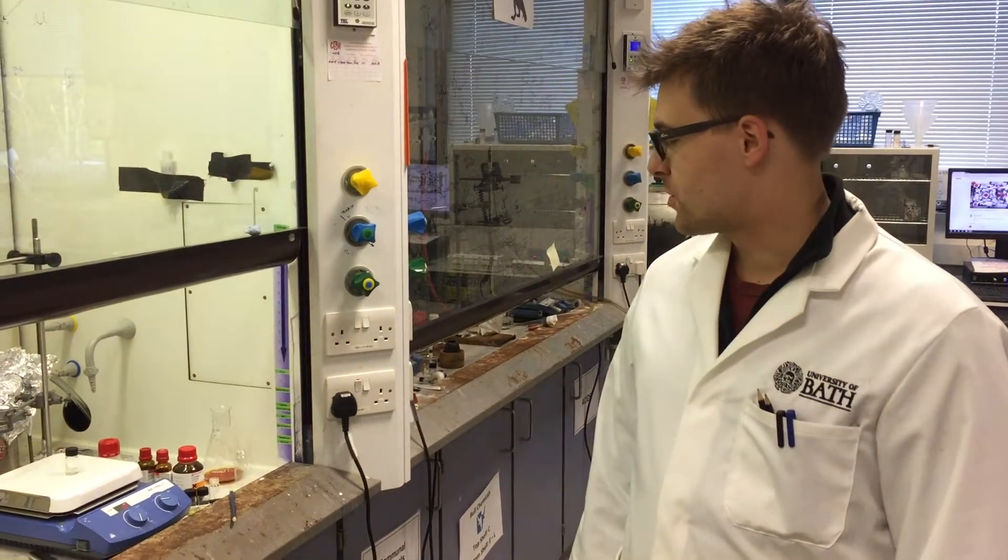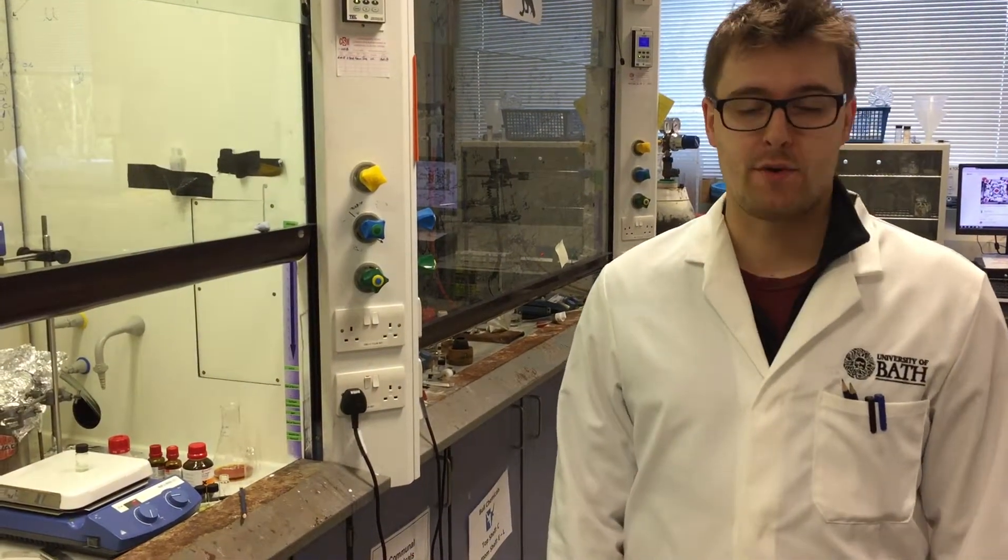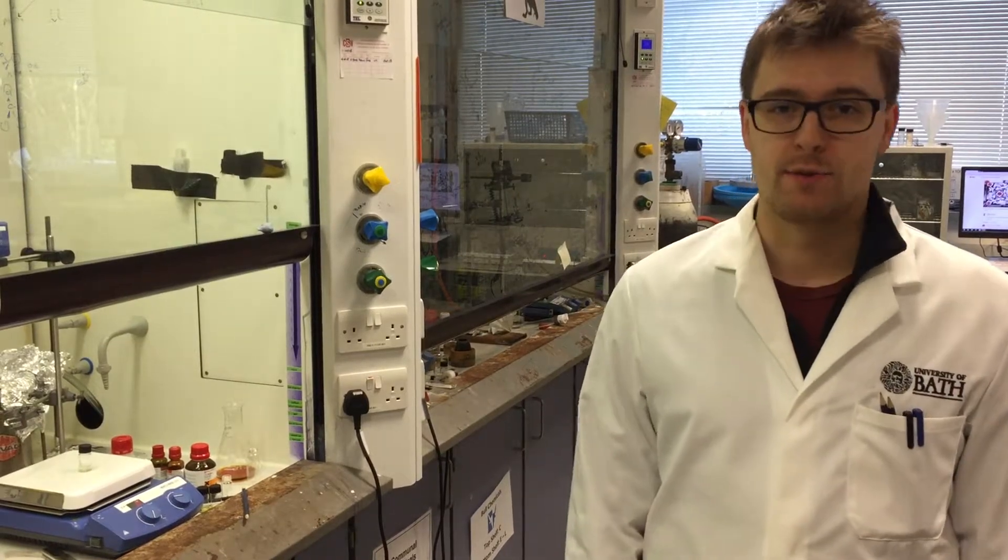Right, we're going to talk you through and show you how to run a TLC of a reaction that is currently ongoing to monitor its progress.